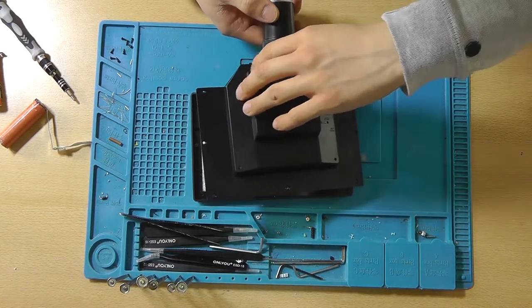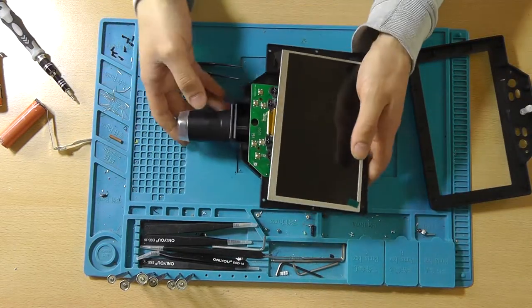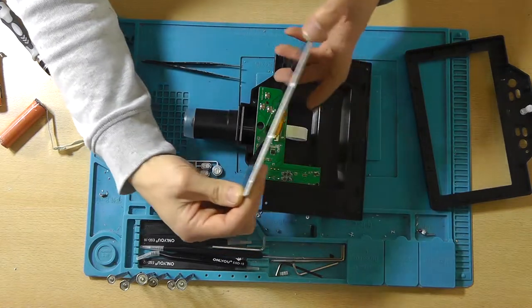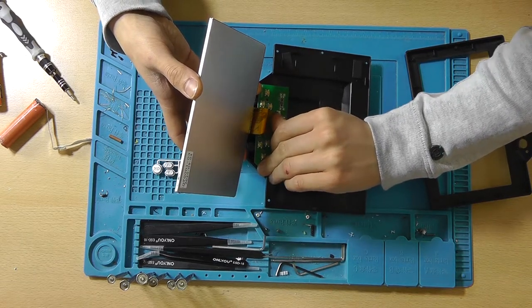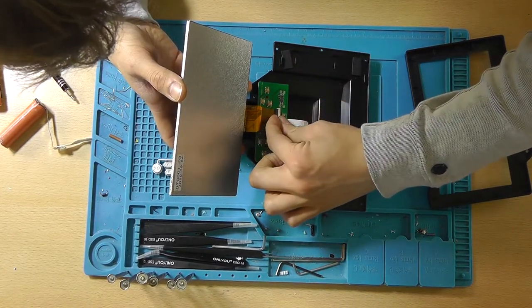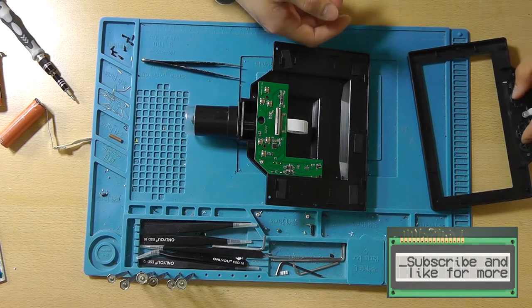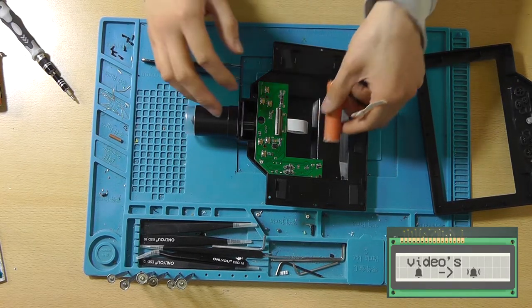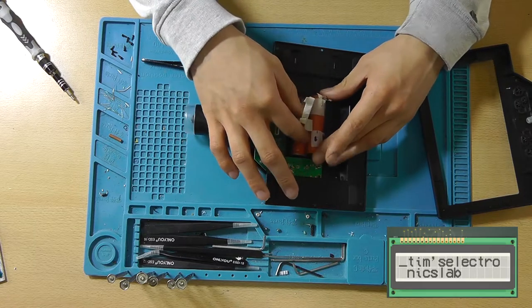So I think that this should indeed be it. There's the screen and the buttons. Let's actually remove the screen. I've got more space to work with. Put the buttons back in their position. Yeah, as I said, I think that there's plenty of room for the batteries. Maybe one, maybe two. I think that two will work just fine.